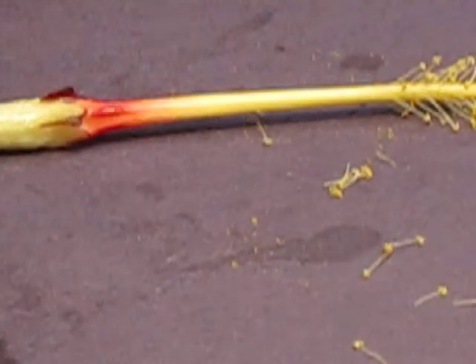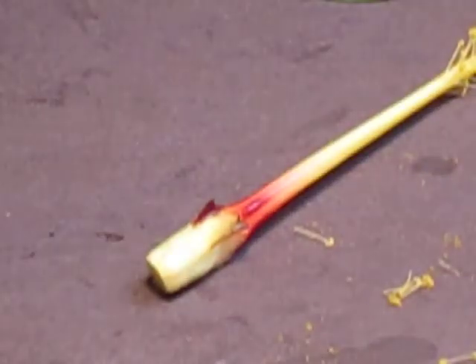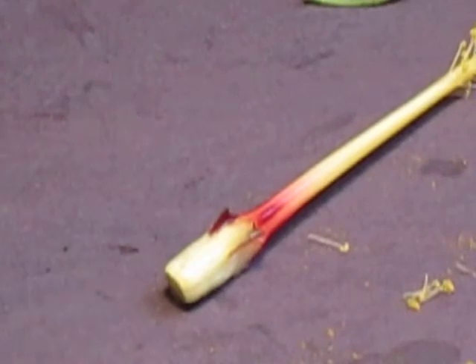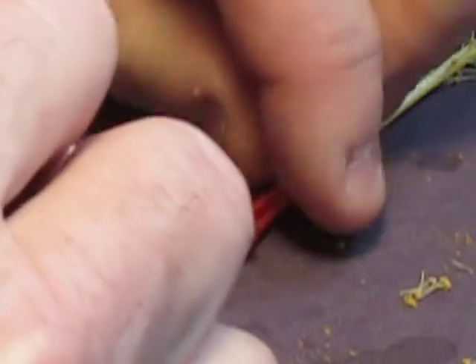And it's at the base, and it's the reproductive organ of the flower. And I'm going to kind of twist it out of there, and I got very lucky. It twisted out without breaking apart on me. Let me make sure you guys can see that. And what I'm going to do is take my X-Acto knife, very sharp blade. You would not want to do this at home without some sort of adult supervision. I'm going to just put it in there.